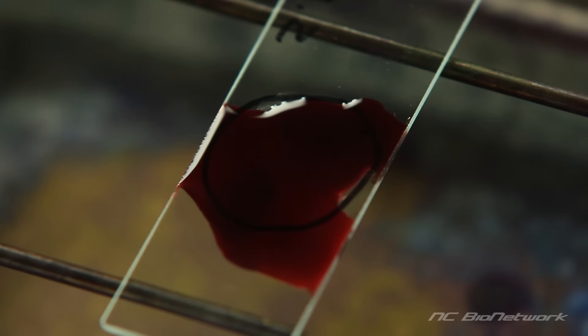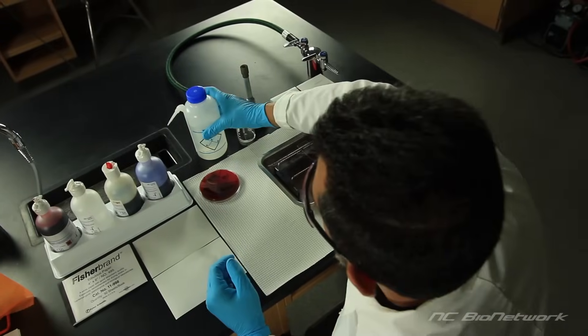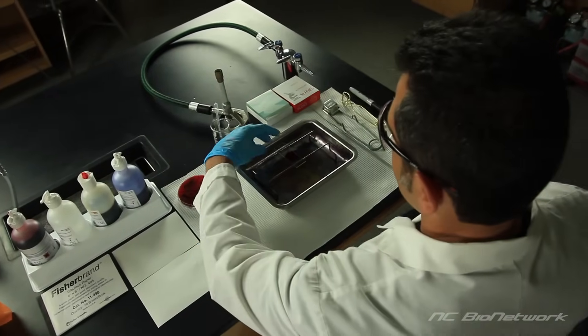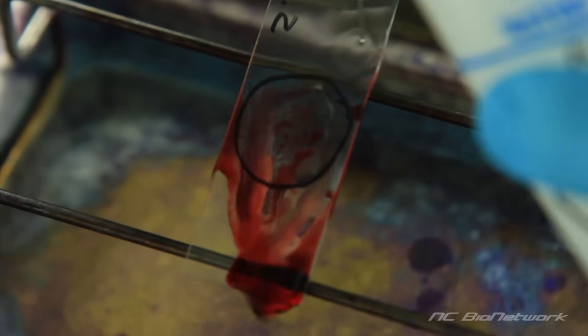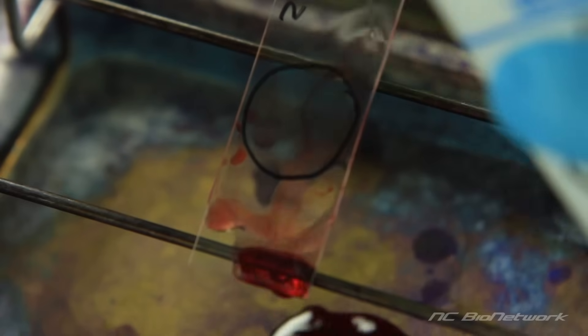Leave the stain on for 30 seconds. Gently wash the slide with distilled water. Drain off any excess water.